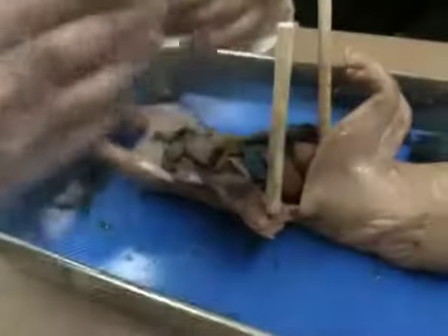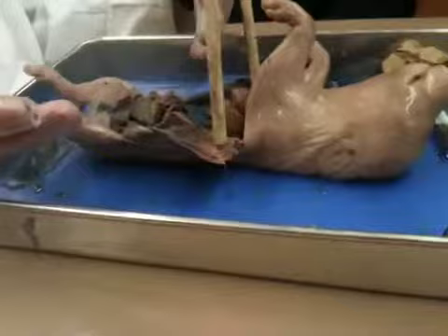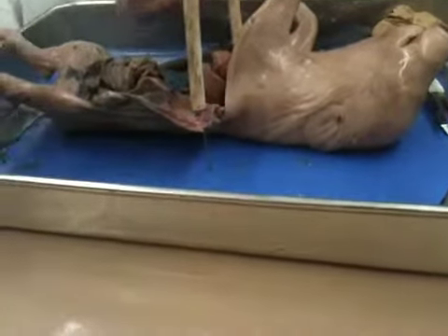But Thursday, when I take apart the pig further, I'm going to give you an exterior view and an interior view of these different organs, and I'm going to send you around with a sheet of paper, and I want you to identify them. So pay attention. At that time, you might see the villi, but if I were to cut open the small intestine, you're not going to see them right now.